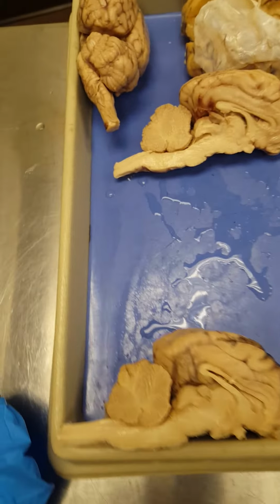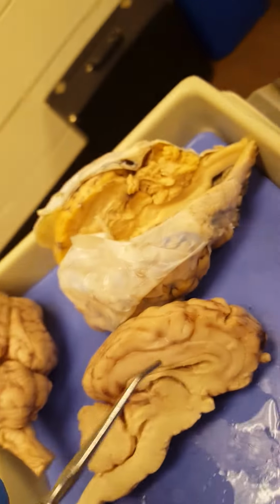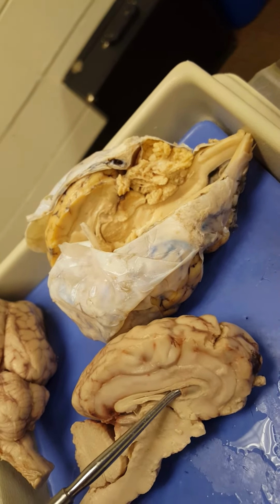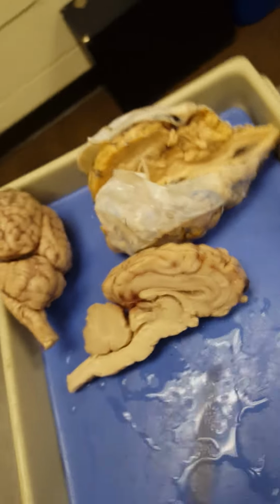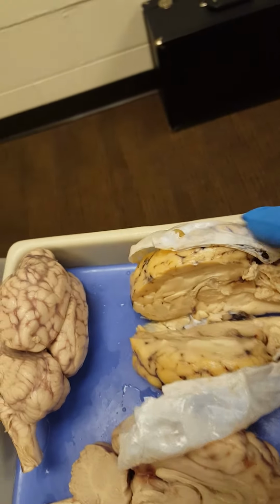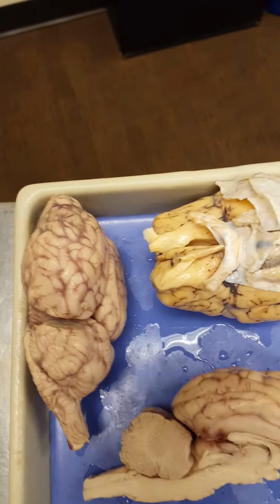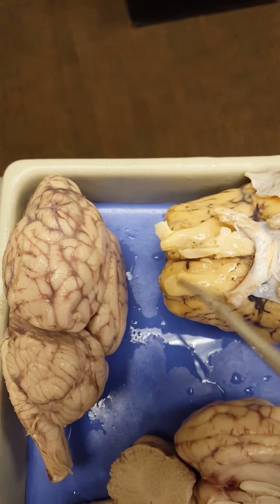Now I want to point out something to you guys. Between the lateral ventricles, and that's on this model, I pulled this guy out for a reason, you can see that clear piece of connective tissue called the septum pellucidum. Okay, so there's the septum pellucidum. I also pulled this guy out here because he's got that dura mater, that tough outer layer. And then on this guy, if we turn him over, you can see those huge olfactory bulbs, okay, on the underside of the frontal lobe.